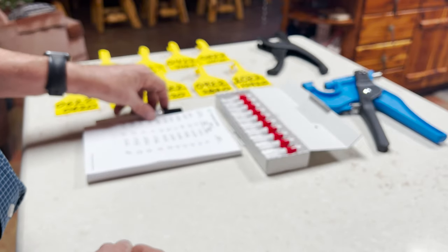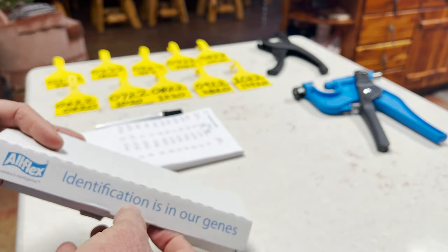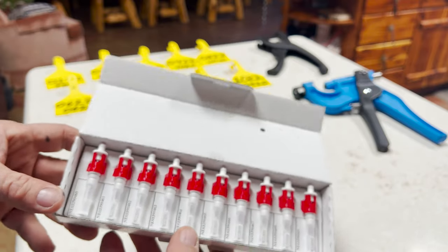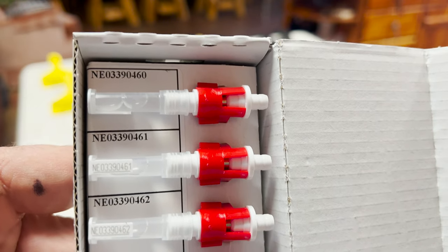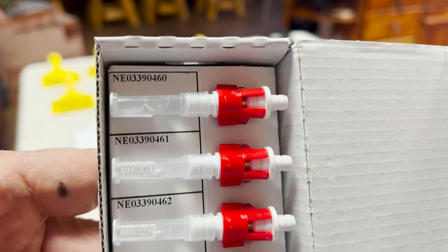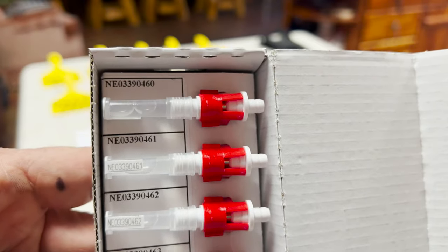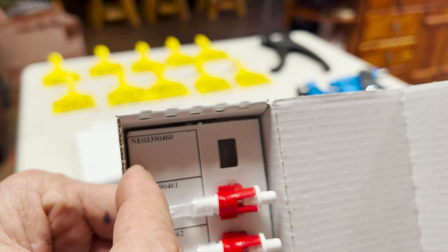Next you've got to collect your DNA sample. I ordered these from a company called Neogen — they're Allflex DNA sampling tubes and they come numbered so you can't get confused. You want these numbers to show up. So the first calf I'm going to tag will be tube number 03390460, and I will write her tag number 010122 underneath the sampling tube. There's space right there to write her new number so we don't get any confusion.